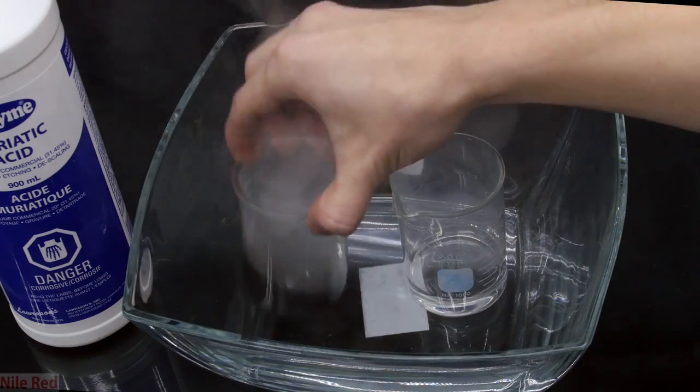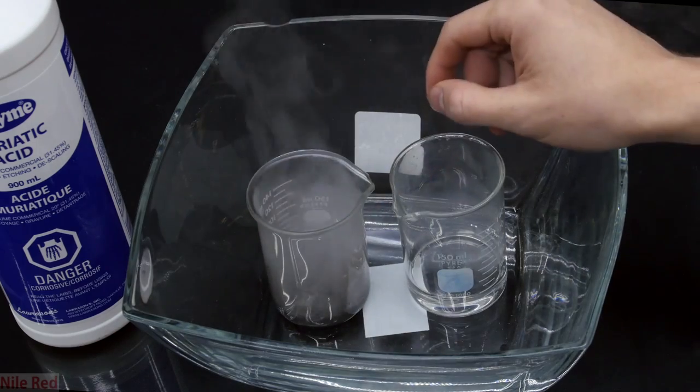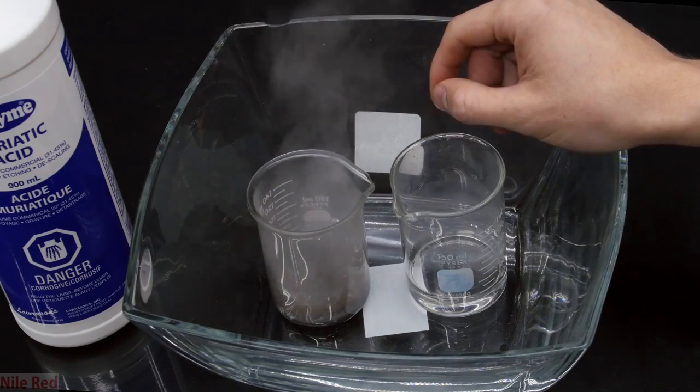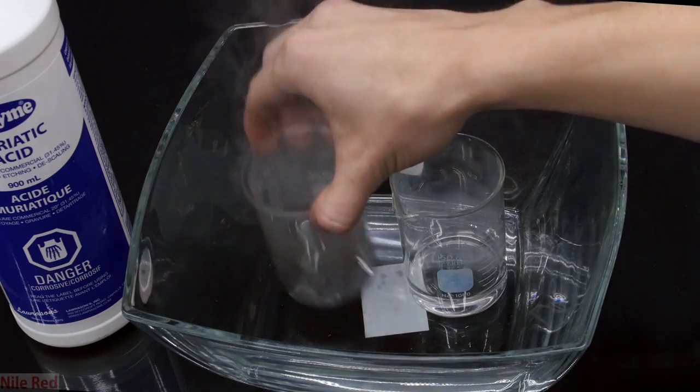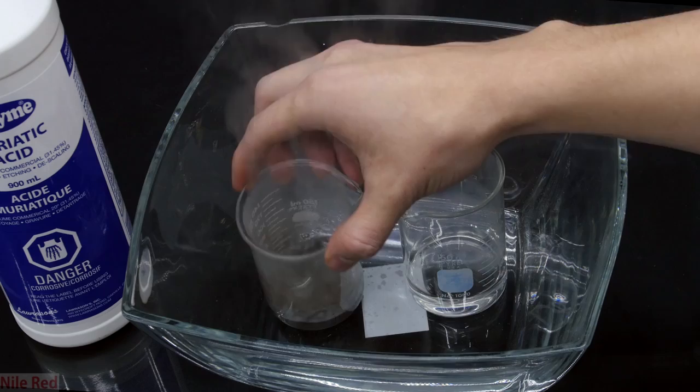I also purposely did this in one shot and kept my hand inside the frame the whole time, so that people wouldn't claim that I swapped out the beaker for water or something. Anyway, once everything's reacted, I figure I'm done with it and I move it to the side.